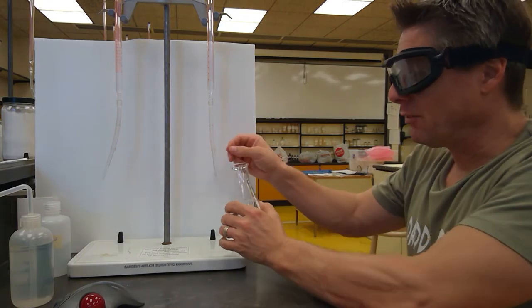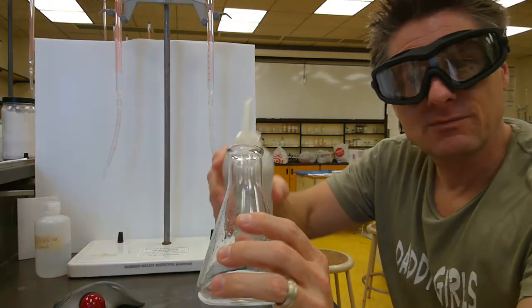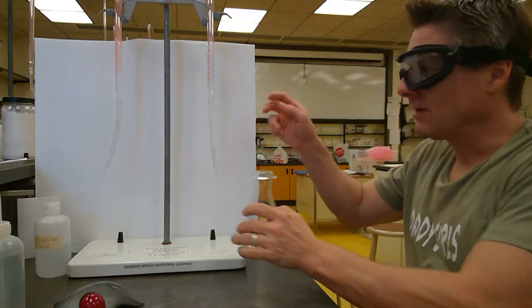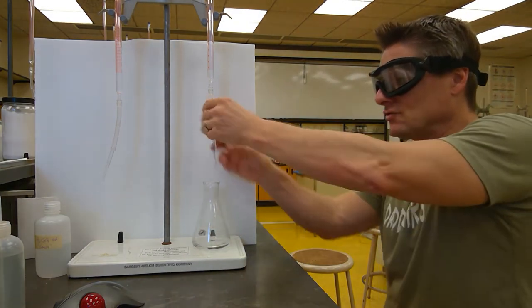And then every time you pull this out, you'll get little droplets up on the inside neck sometimes. A lot of times I'll tap one off. You always want to spray that down with DI water. That's really, really important, right? So let's do that real quick. Let me raise this up a little bit. Let's add the base. And then I'm going to swirl this.